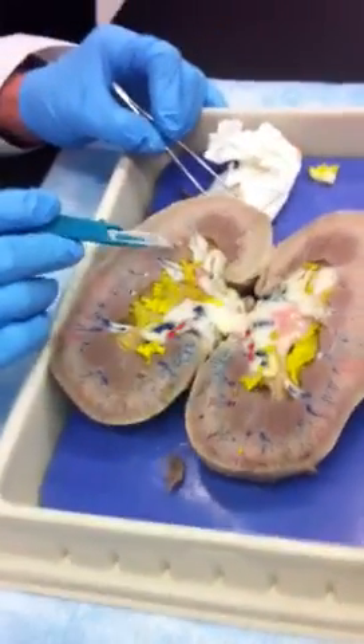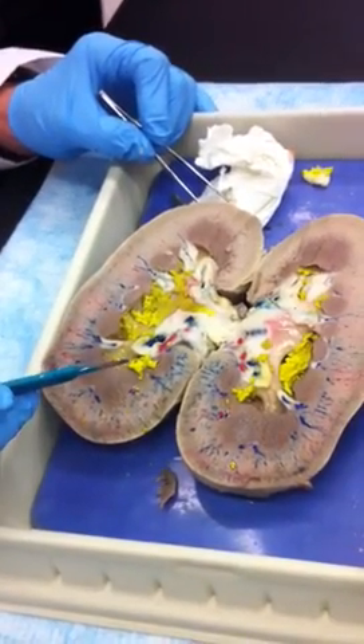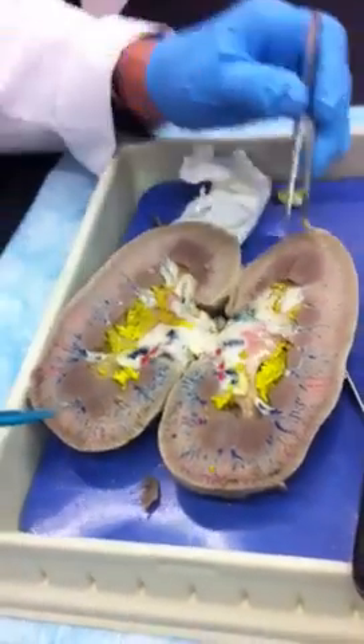There's a pyramid. There's a column. The papilla is right there. And there'll be another papilla here we'll see pretty well, too.